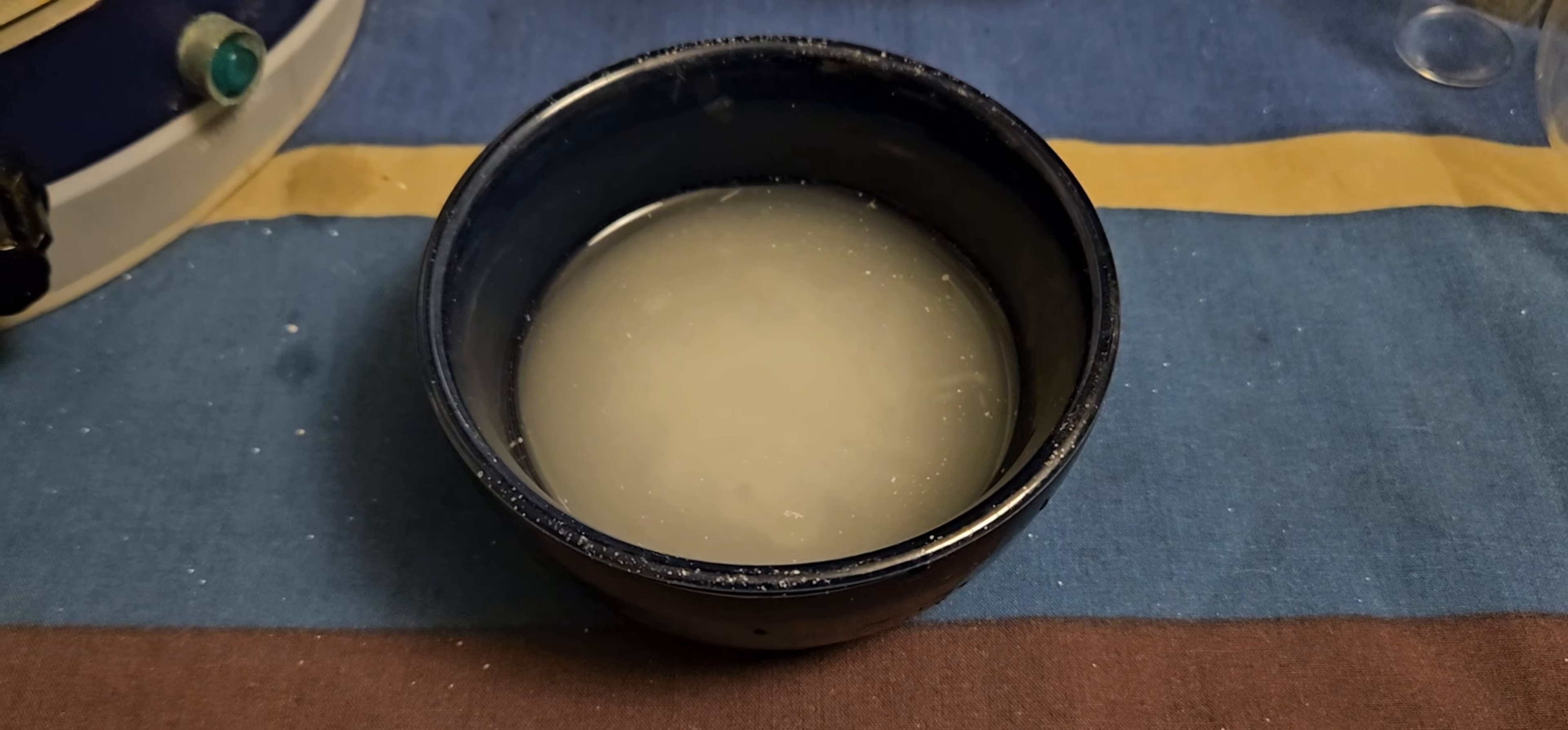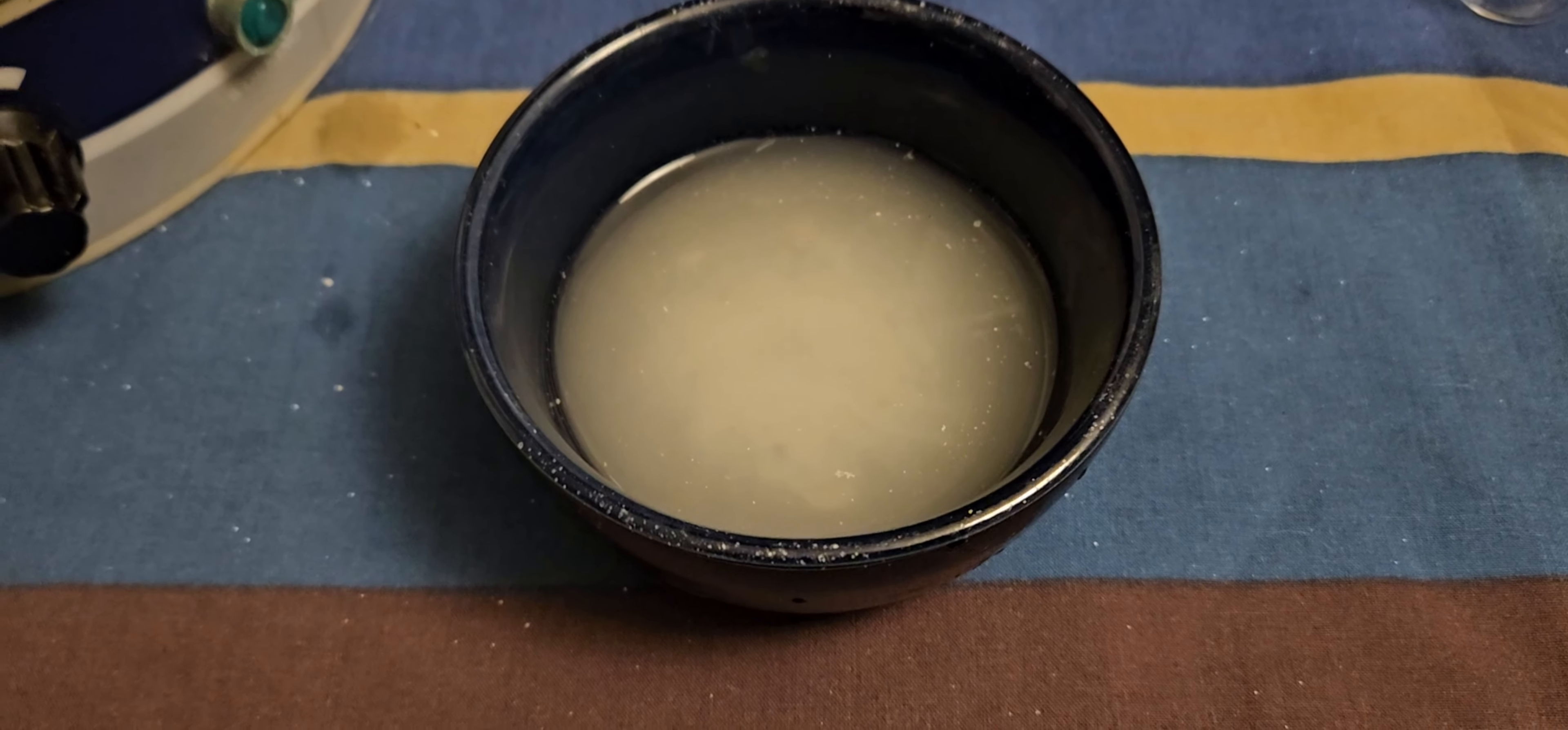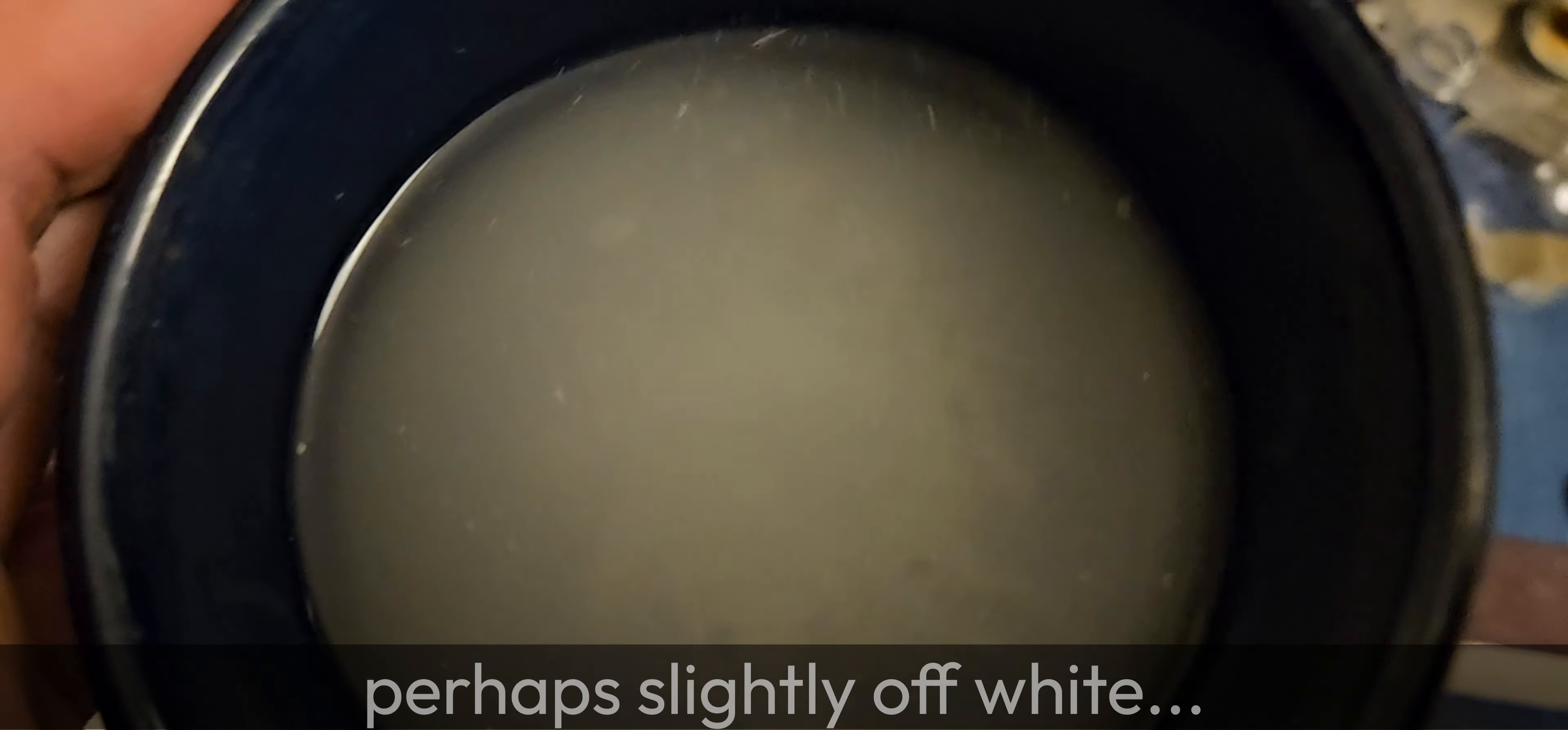I placed it in a dish with water to scrape off the thorium dioxide which is a white powder on the bottom. This should be quite clean now.